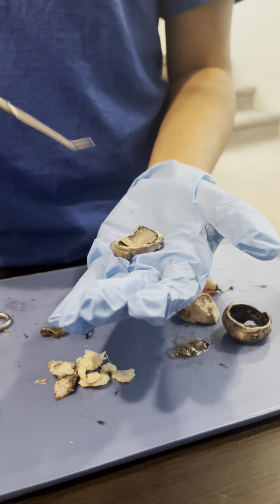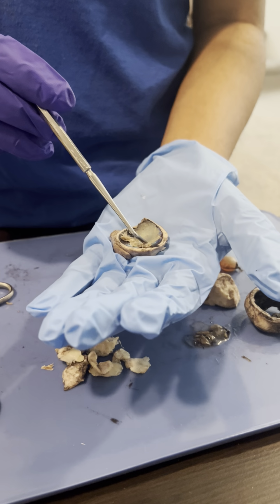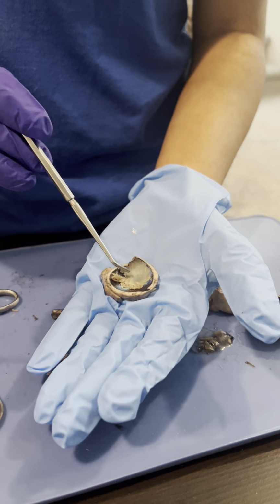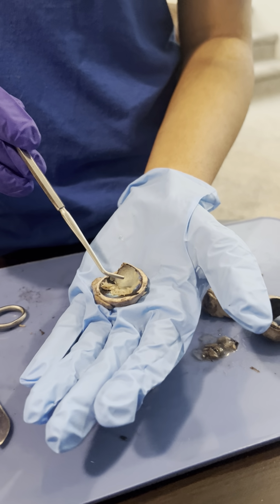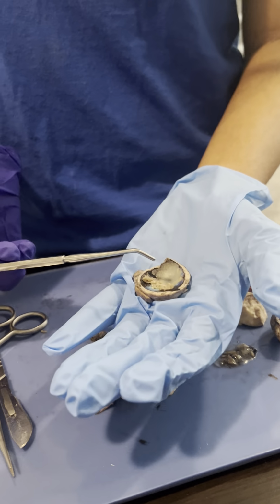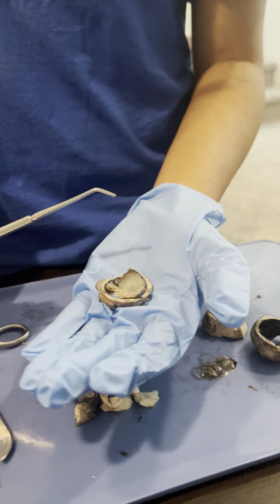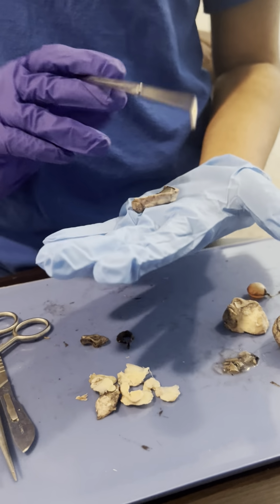Both these rods and cones conjoin in one spot, which you might not be able to see very clearly, but over here it gathers into an optic nerve, and it's also a blind spot because the receptor cells converge and you can't see through that area.